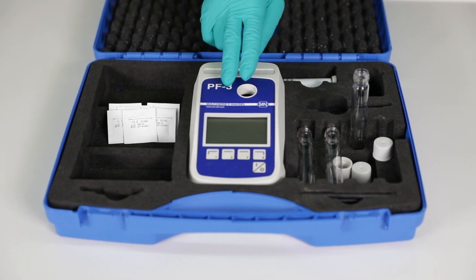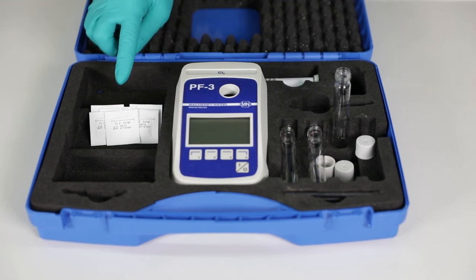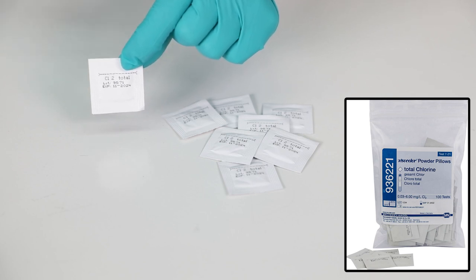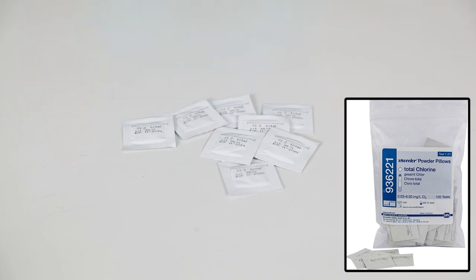Therefore, you need a photometer, cuvettes and DPD reagents. The reagents have a limited shelf life, so please check the expiry date before you start with the calibration.